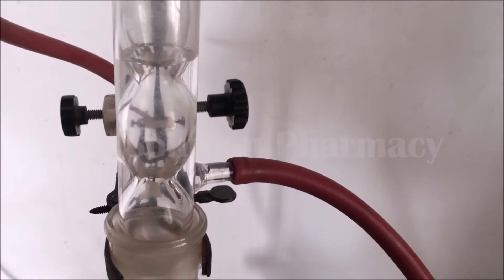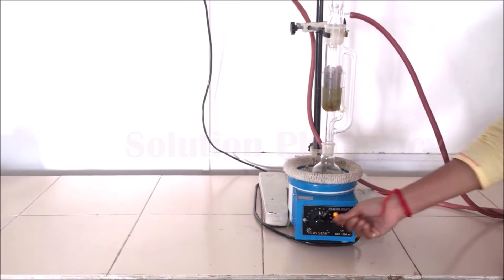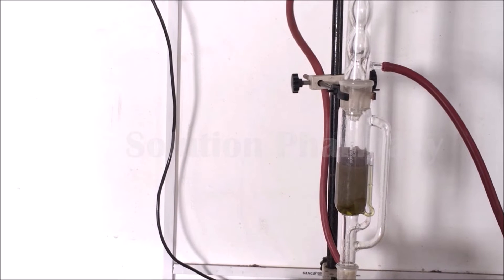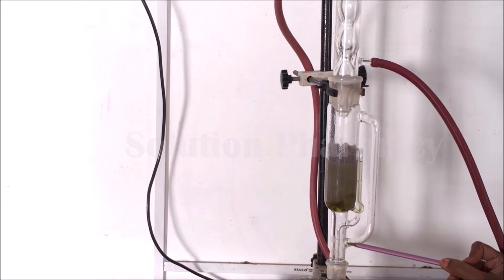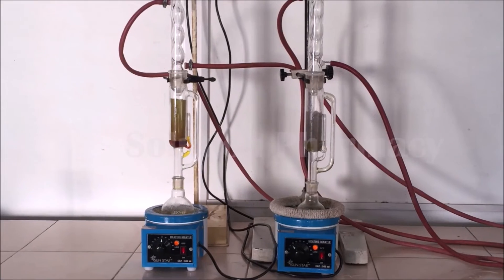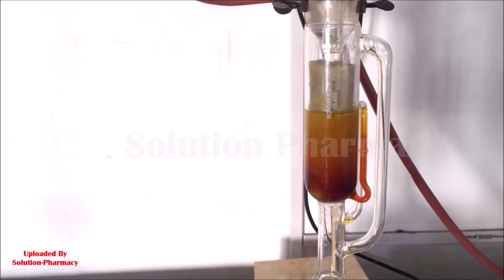Turn on the water source and the heating mantle and set the temperature to the boiling point of the solvent. On heating, the solvent in the round-bottom flask boils, evaporates, and passes through the side tube of the Soxhlet extractor. The solvent vapor then passes to the condenser, where it condenses into liquid and drop by drop falls back into the Soxhlet extractor where the crude drug is present.